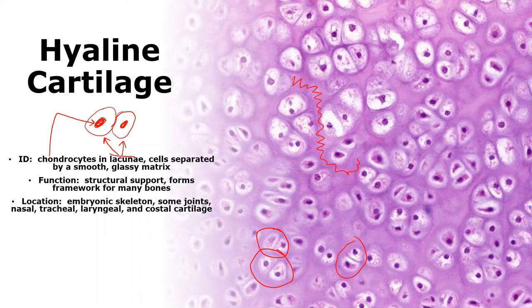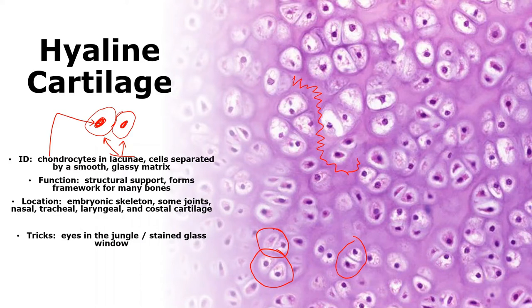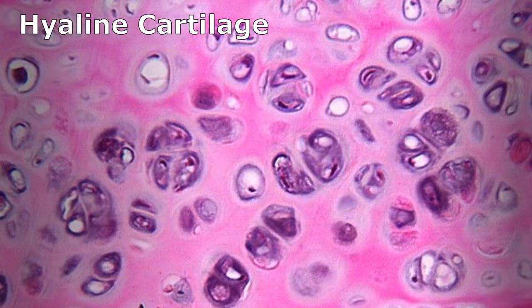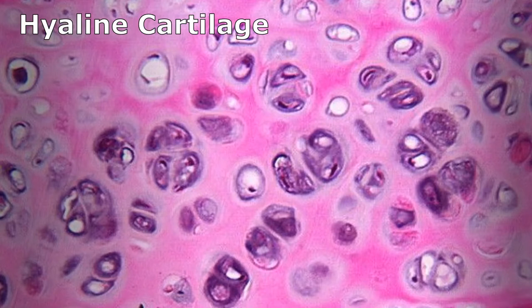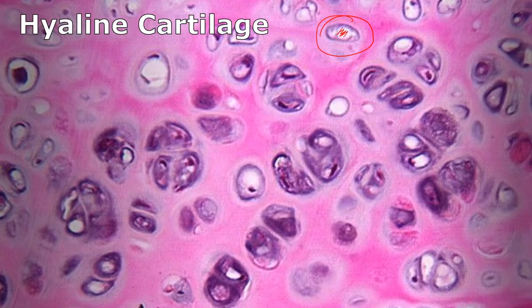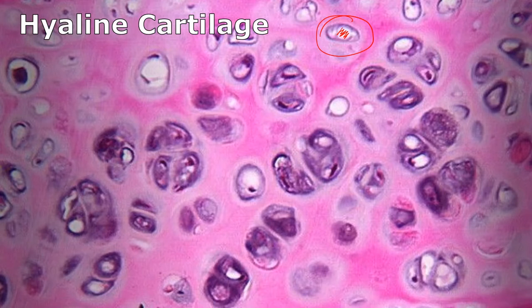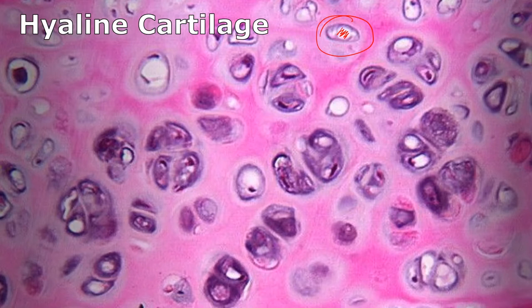If you know you're looking at cartilage, the default answer is hyaline because that's where we find it most. Tricks: stained glass window, eyes in the jungle. Looking at hyaline images, I can see chondrocytes sitting in lacunae, smooth pink glassy matrix with no cracks. Function: support.